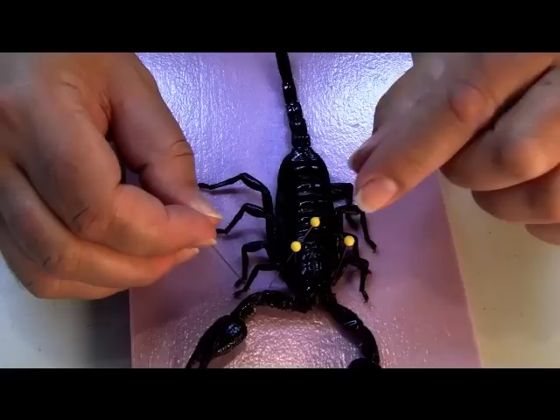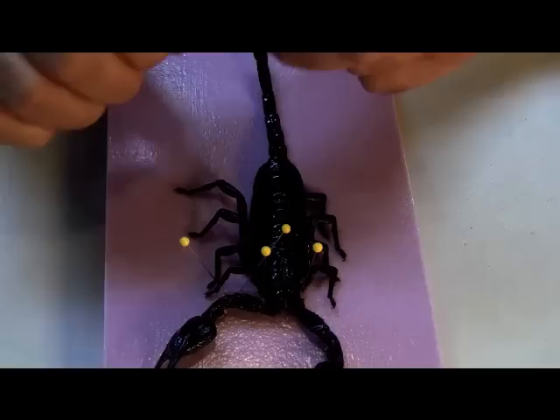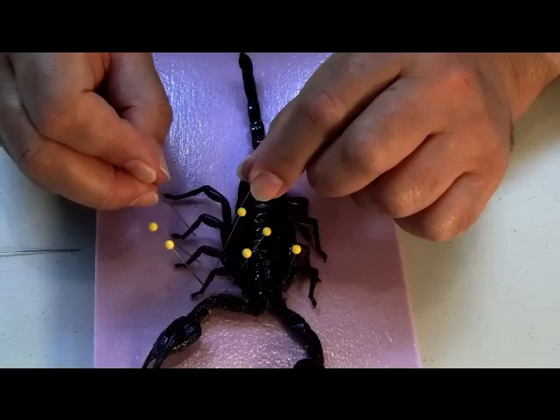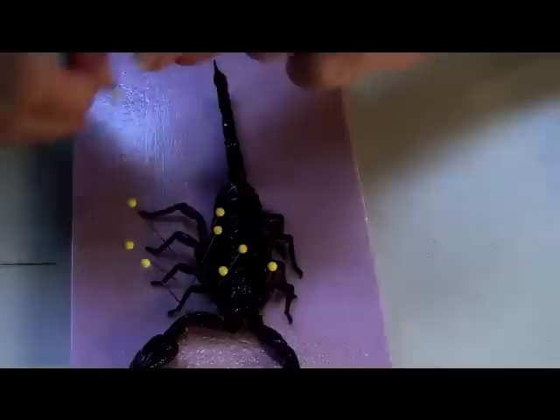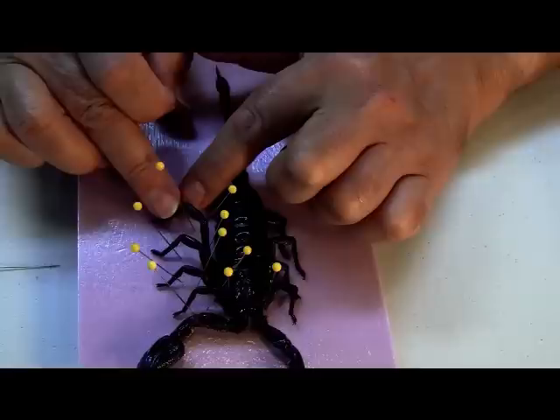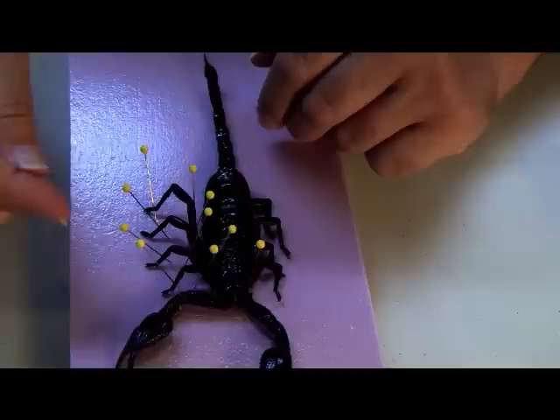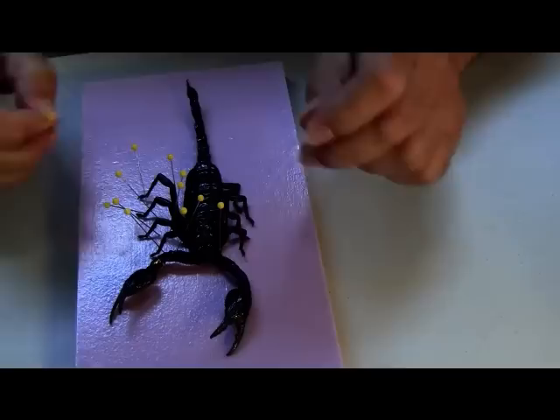You're going to start to position the legs using pins. Position each leg as you want, and you'll continue with all four legs on one side. You can position the legs exactly the way you'd like — either farther out, in, or slightly higher up. Normally scorpions get into little areas and go in almost flat, so they're not very tall creatures.